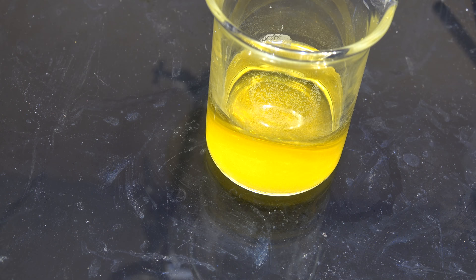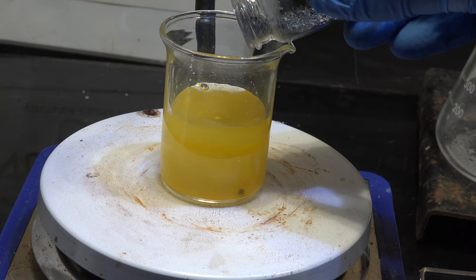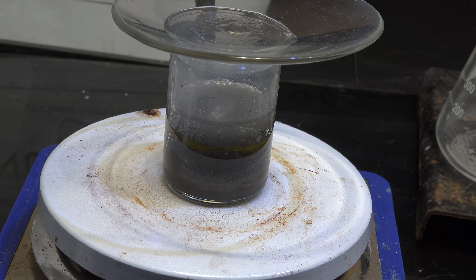So while my filtrate looks like a lot, it's actually practically nothing. Nonetheless, there is some palladium in there. So I will add this to my stock of precious metals waste for future recovery. To reduce the volume of material I need to store, I'm going to add some zinc metal and cement out all the remaining metals in solution. I can then filter the residue and store the metals without the salts currently in solution. I'll show you how to recover palladium once I have enough.